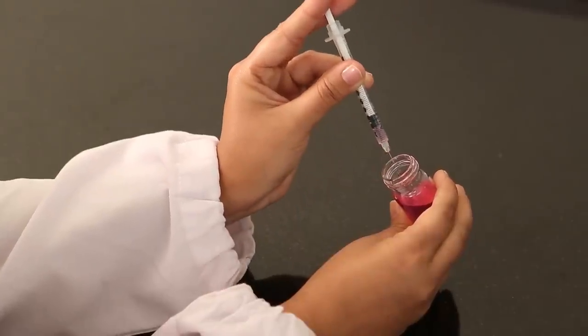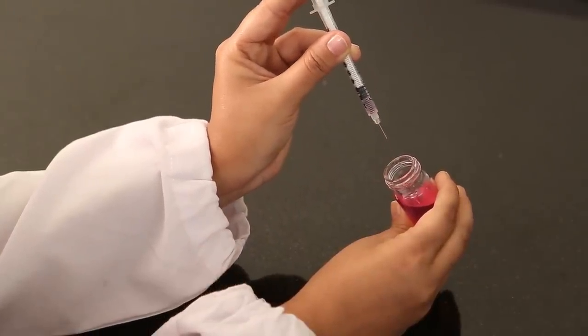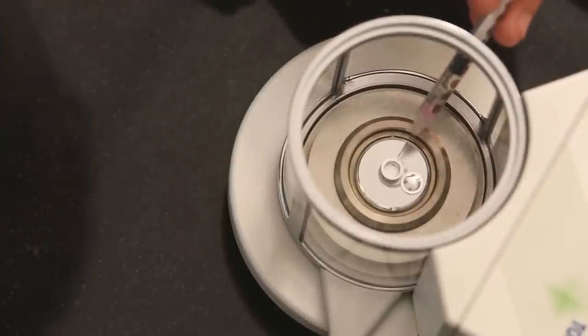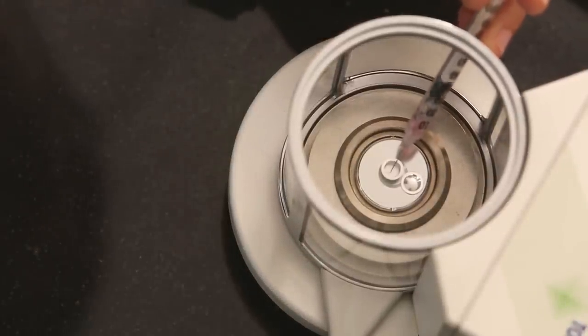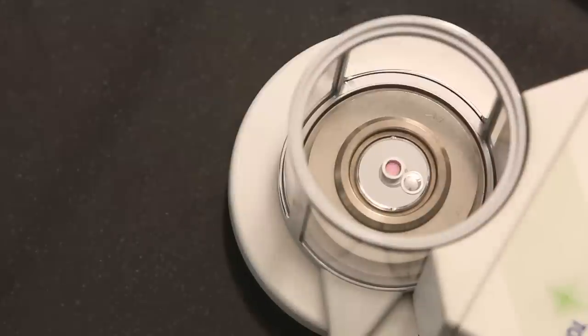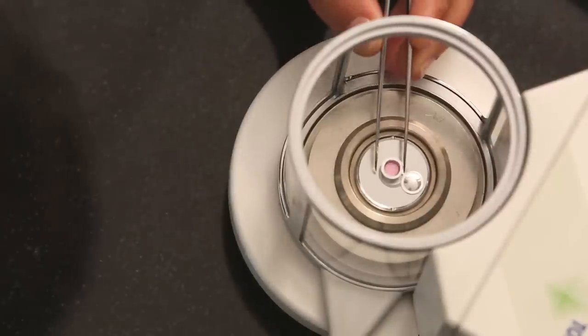After taring, fill in the liquid, such as an aqueous suspension, into the crucible using a syringe. Do not fill it more than halfway to avoid problems with thermal expansion. The sample will evaporate as long as the crucible is open, so one should work quickly.